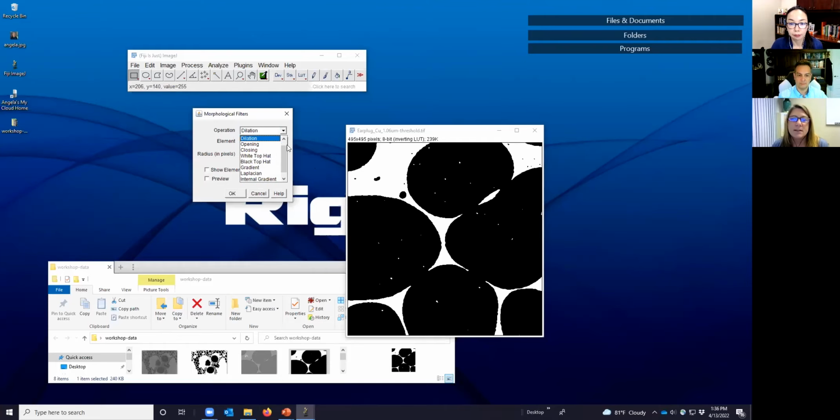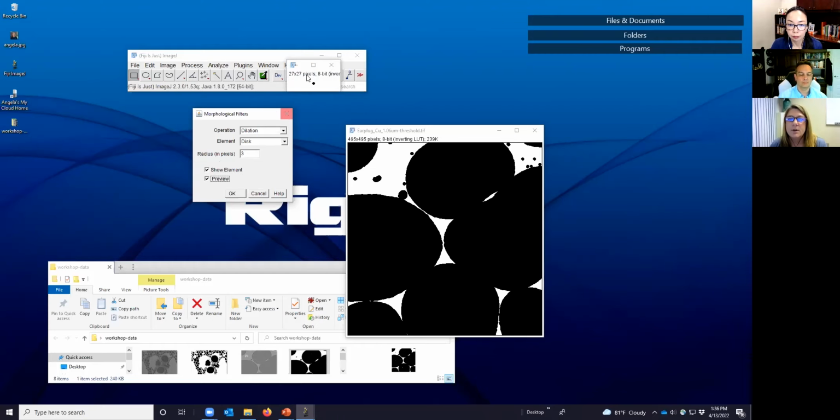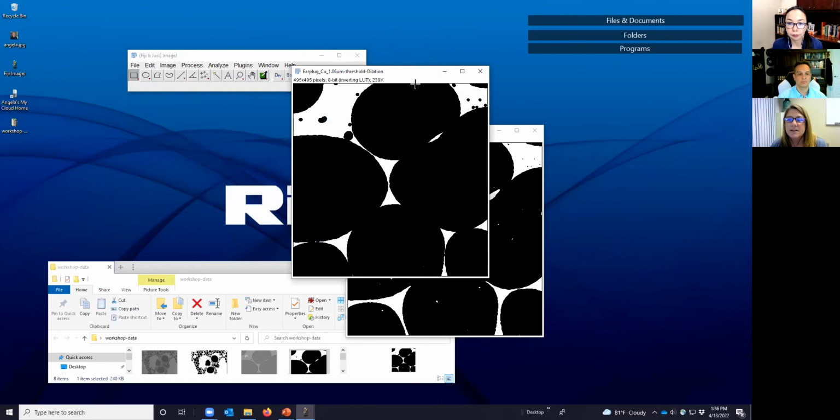From here, you would select the specific operation that you want to do. In this case, if we want to do dilation first, we can select the structural element we want to use, and there are the 8 of them that I mentioned before. Let's use the disk in this case. It makes sense based on shapes. Let's change the radius to 3. If we want, we can take a look at the element and look at a preview. Here's a preview of the circle or the disk that we're using. Click OK, and this is the result.